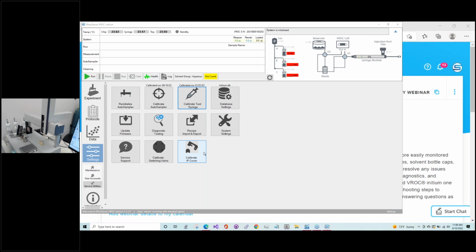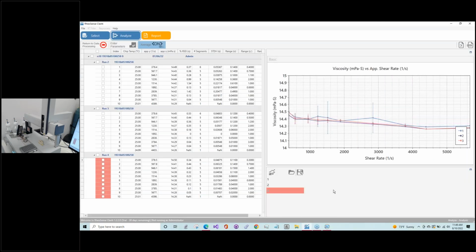And so we're going to switch out now to our analysis software, so you can look at what a Newtonian standard test would be and what good data would look like. So what we have here is our Clariti software, and we've imported our Newtonian standard, which has a viscosity, based on the certificate of analysis, of 14.4.